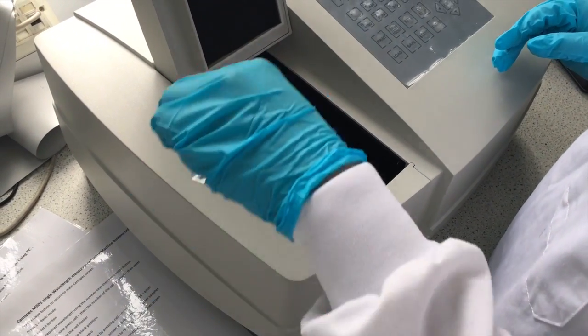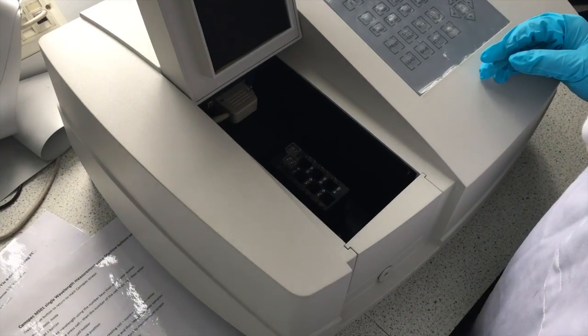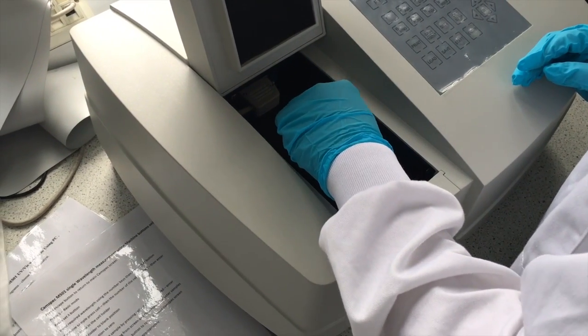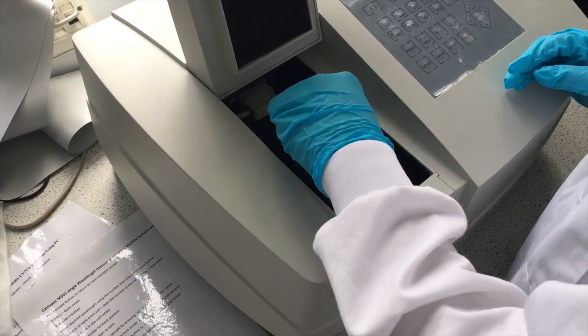We measured the samples at 517 nanometers at the beginning and after 60 minutes until there was no further change in absorbance readings.